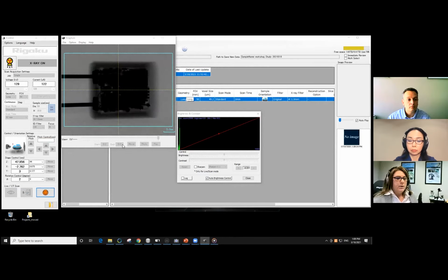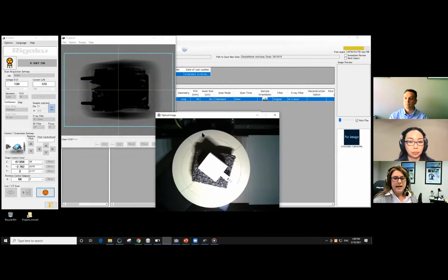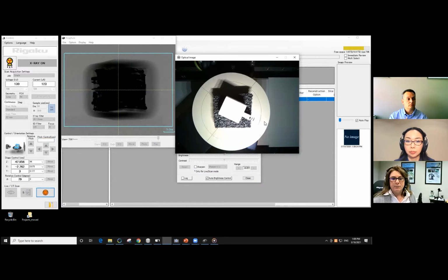Okay, so we can track the progress of this measurement by looking at the rotational control in degrees. It's going to rotate from 0 to 360 degrees, at 29, 30, and increasing right now. We can also watch this field. So it's basically 2D radiographs that are collected along those degrees. And then finally, we can have a look inside the instrument, and you can see the Apple plug here that's rotating.